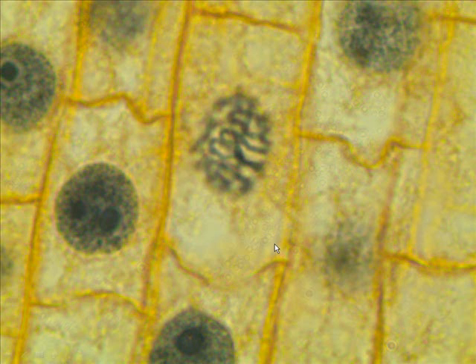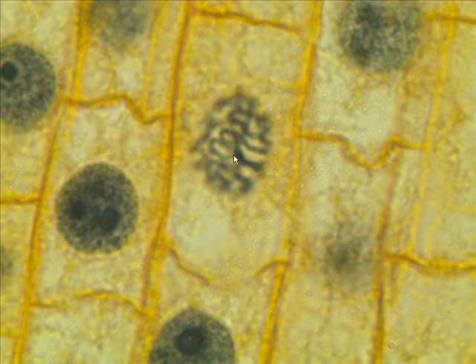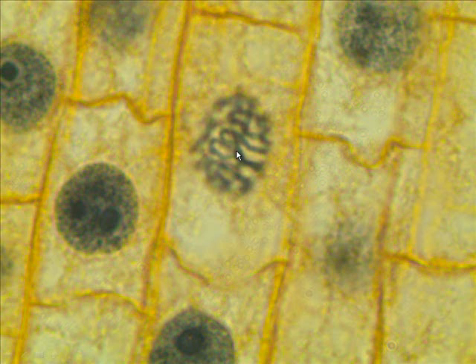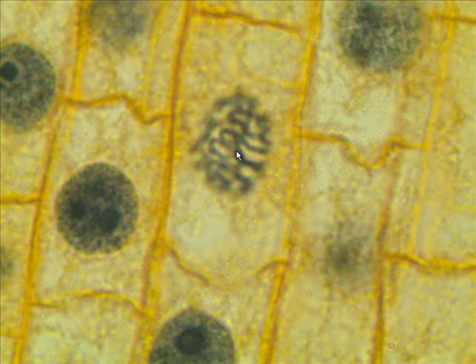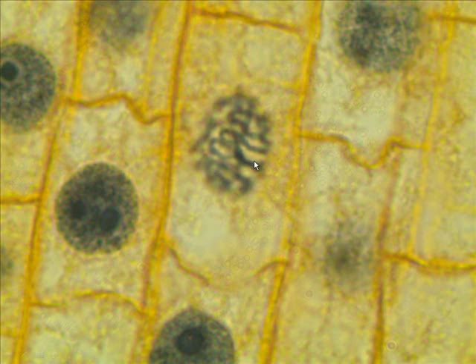Okay, I'm going to point to them and you call them off, then I'll call them off — see if you get the right answer. Here we go.